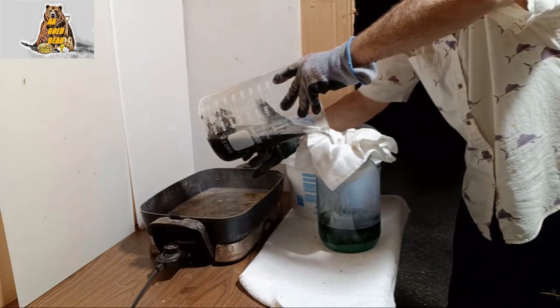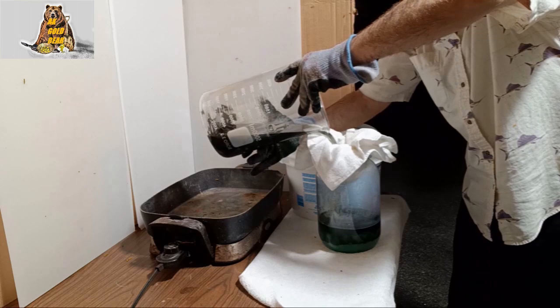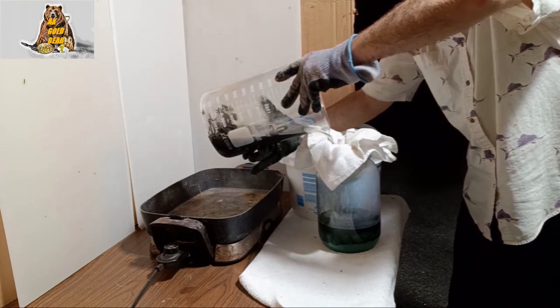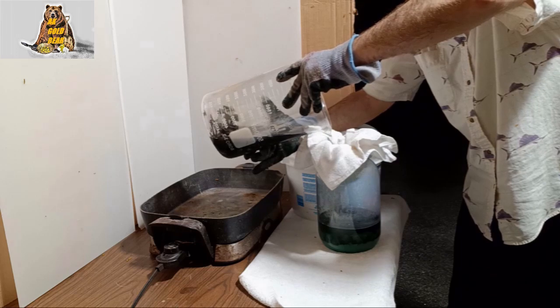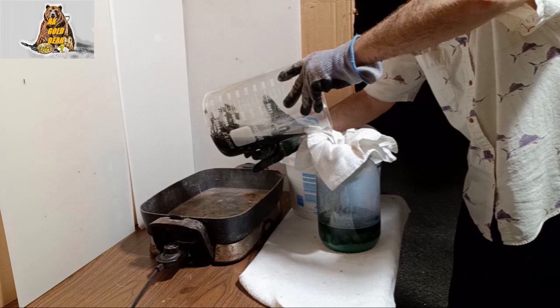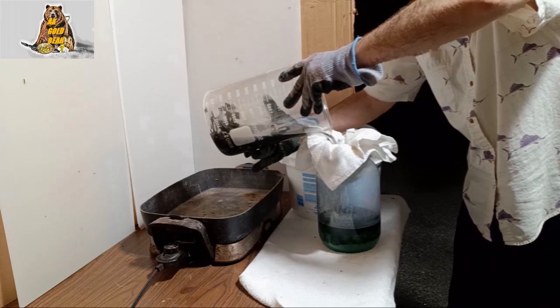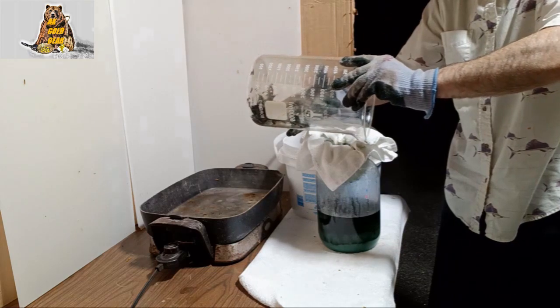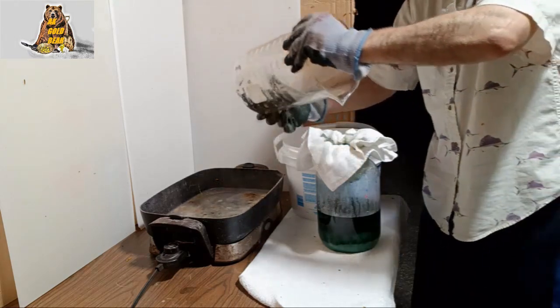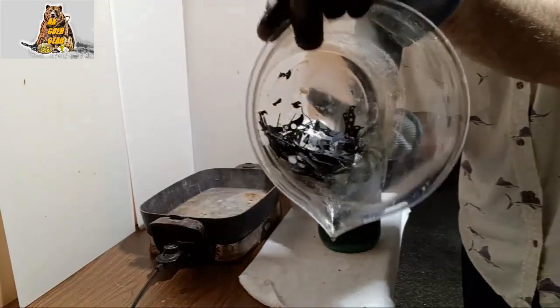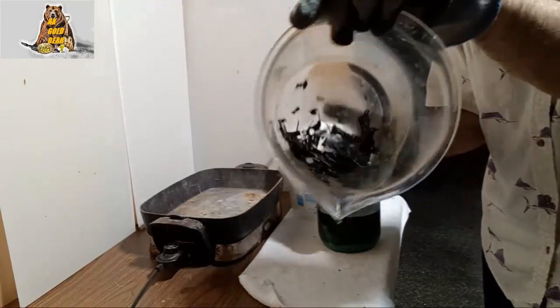After filtration I will keep my solution in refrigerator overnight. That is not necessary you know, you can keep your solution outside no problem. And this metal again I can use again and again, absolutely no problem.